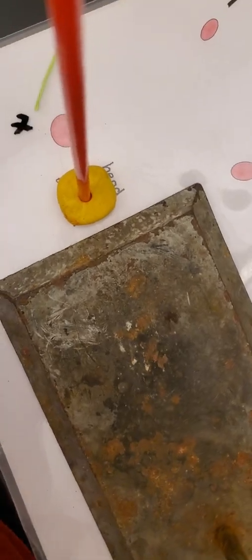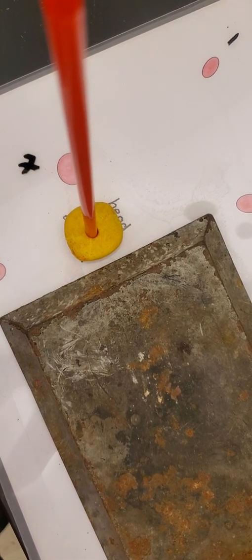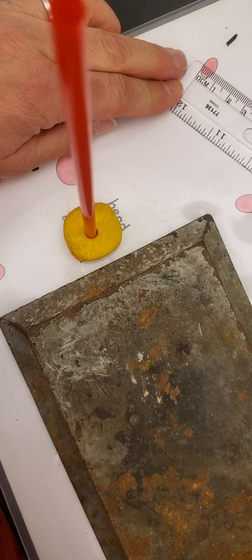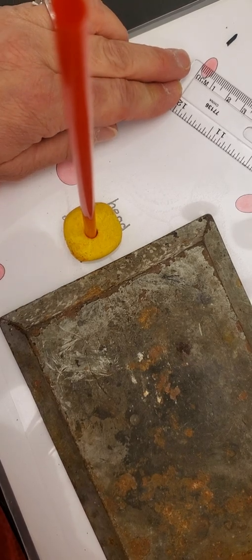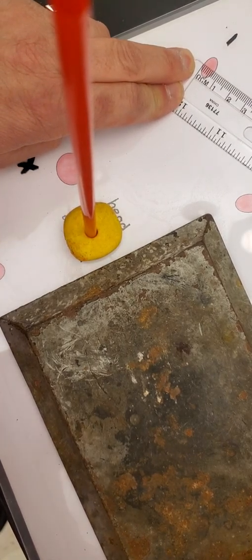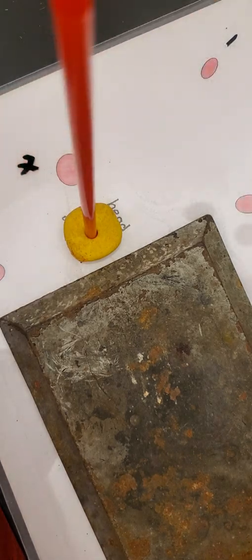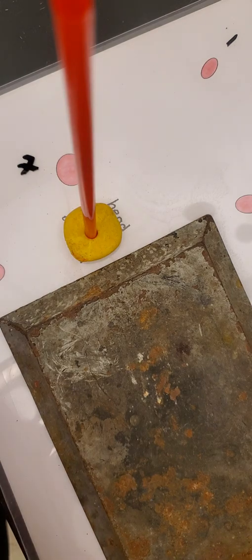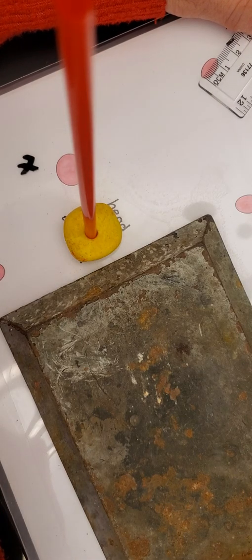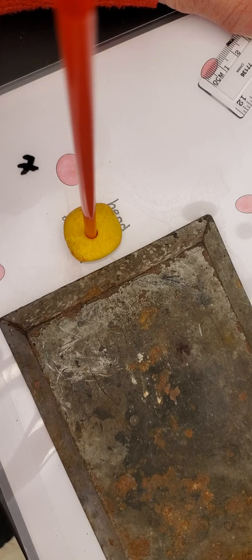Next, we're going to measure one of the blood spatters. It's nice to have a clear ruler. You're going to do this in millimeters or centimeters — the units will cancel out — but make sure you're measuring at the widest point. This one looks like about 0.7 centimeters for the width. Then for the length — the longer part, measured down the center — it looks like about 1.2 centimeters.